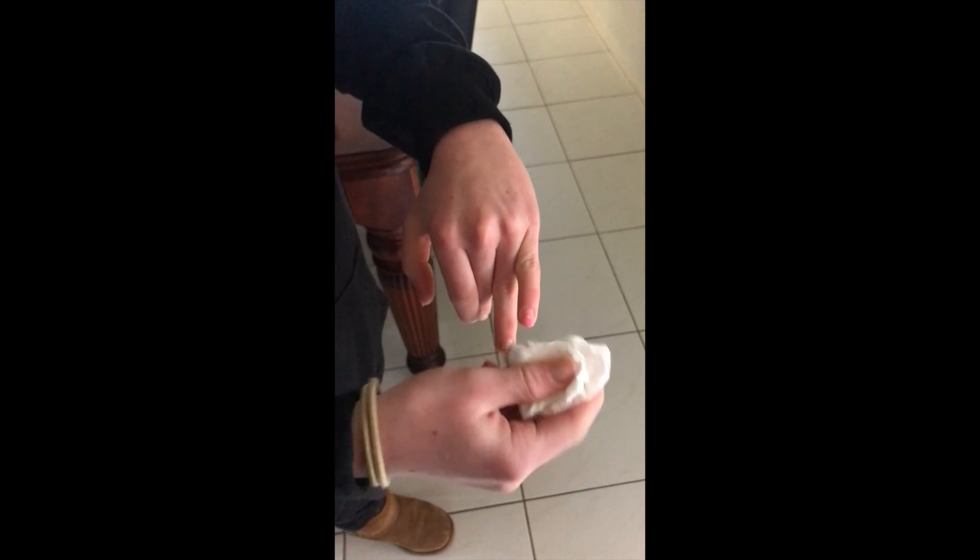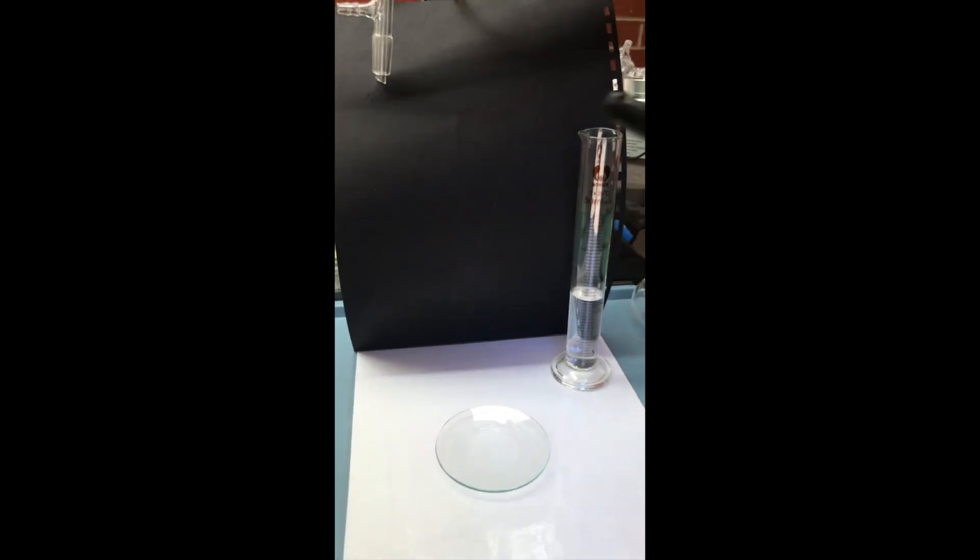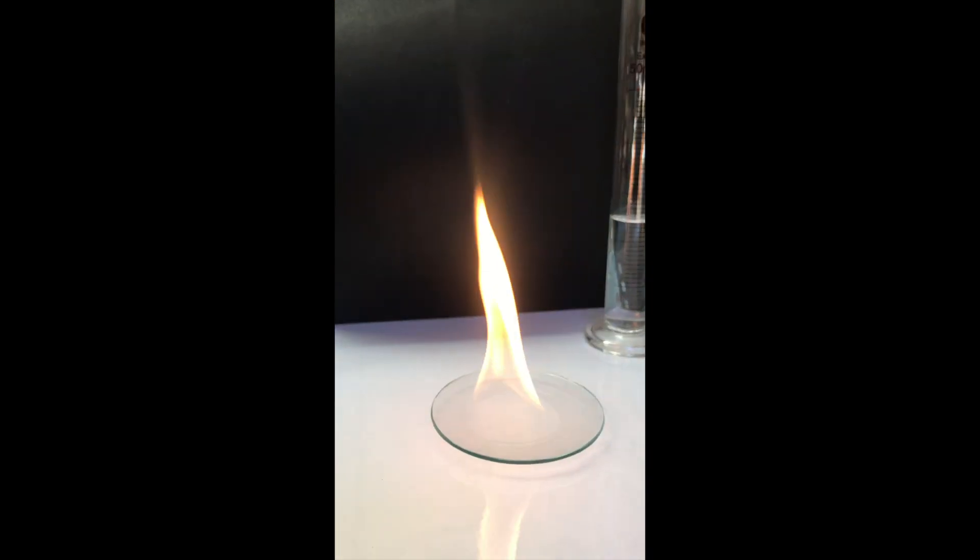Now finally the real test I have some acetone to use as a nail polish remover. At the end of the experiment I decided to do a flame test. Once the flame went out there were only little impurities left.